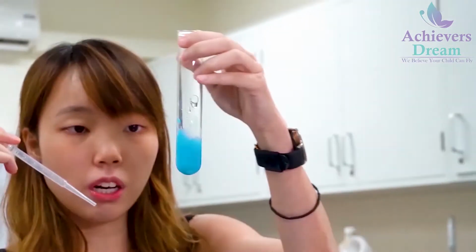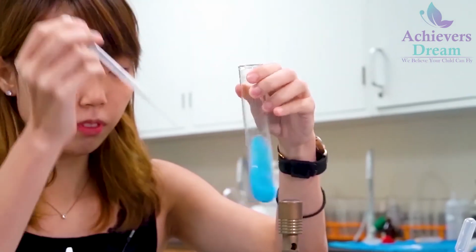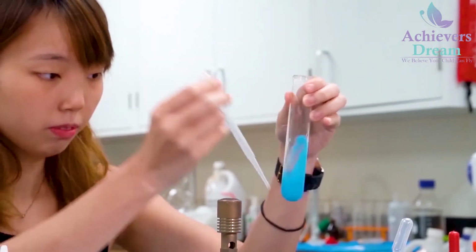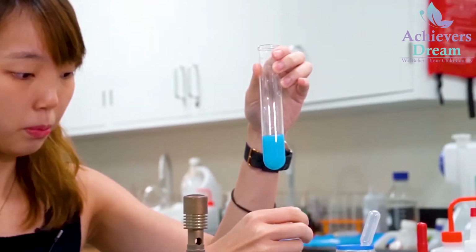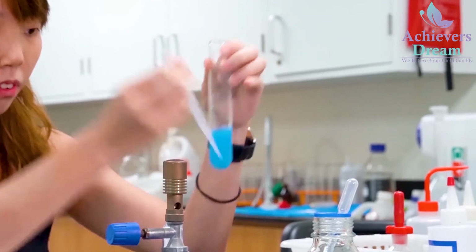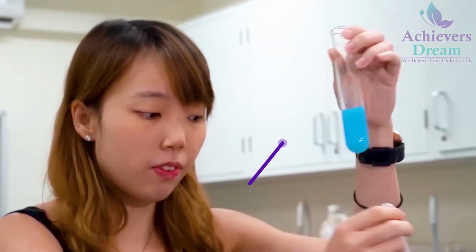Okay, so this is the initial color. Now I'll be adding more. Okay, so you notice that the blue color of the solution has faded gradually.